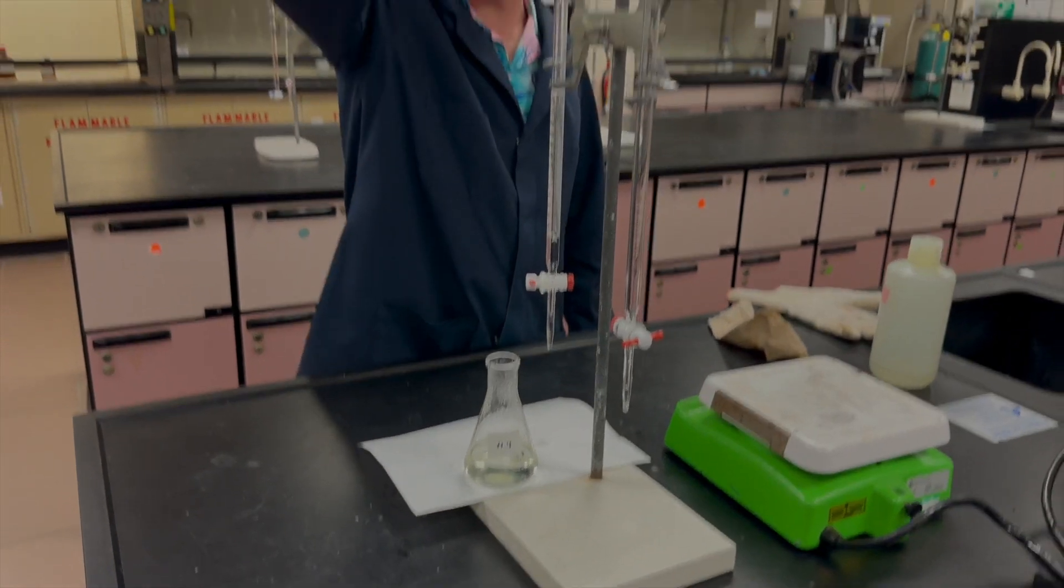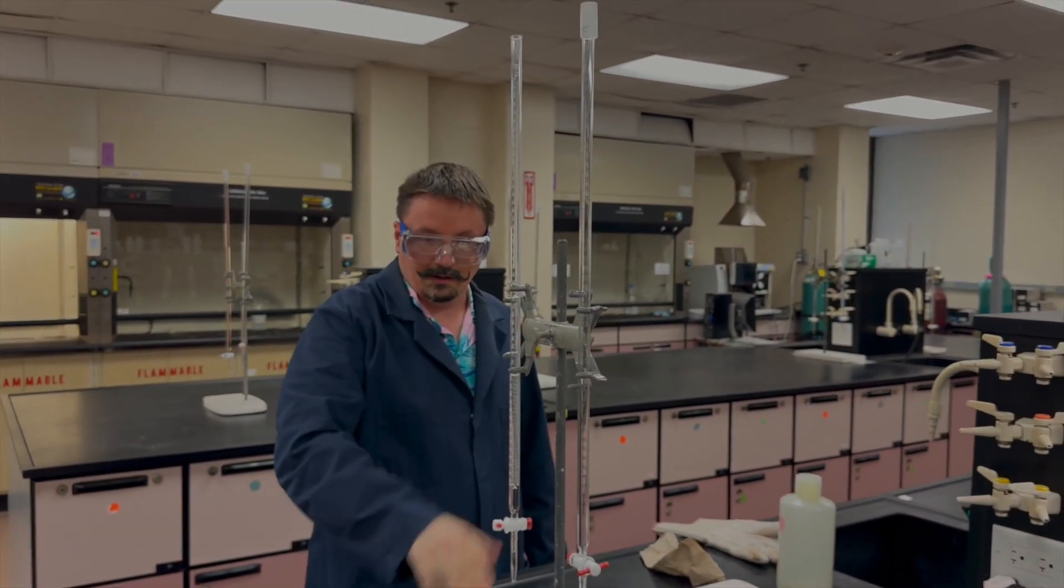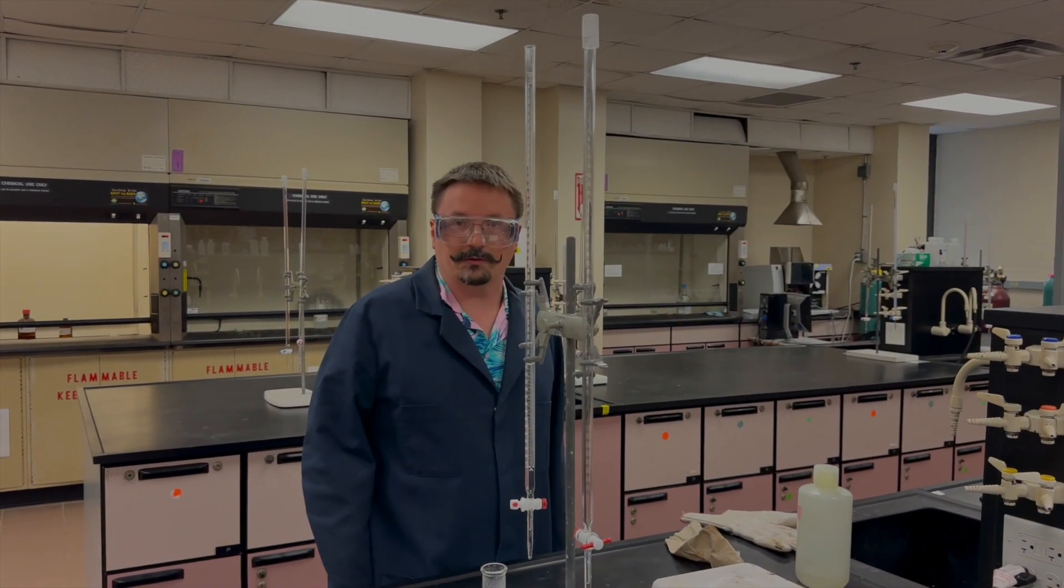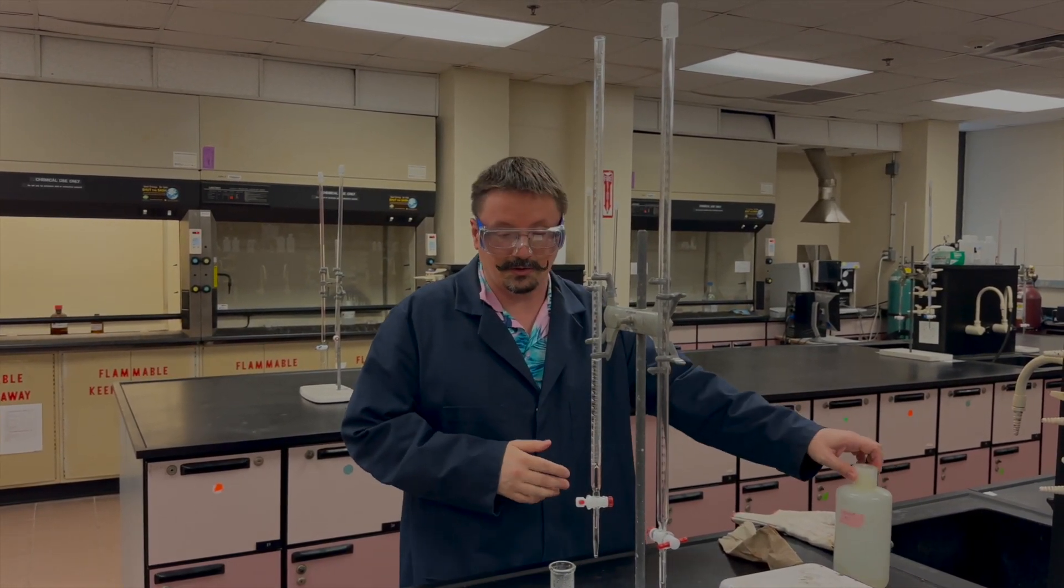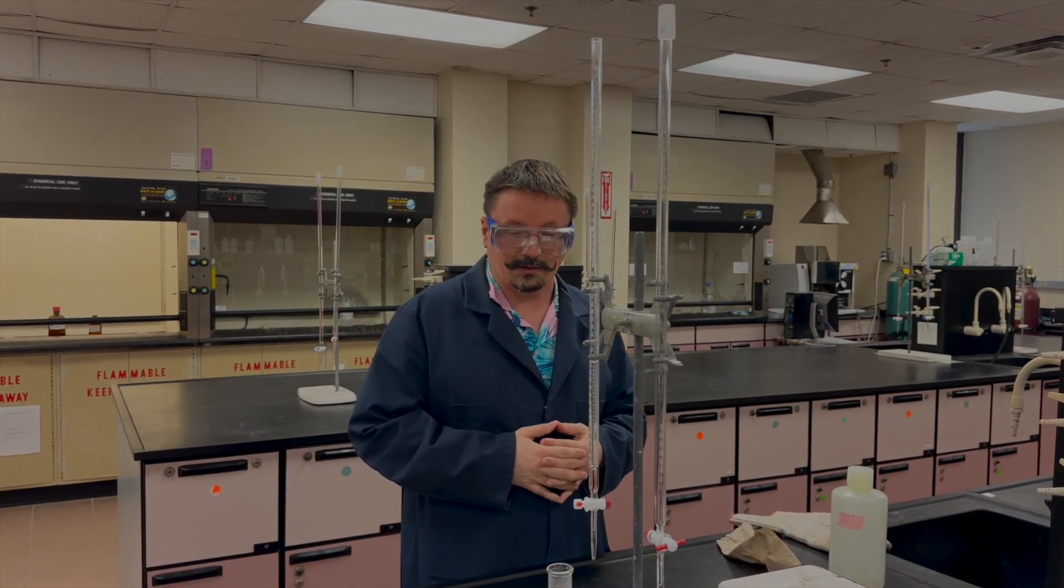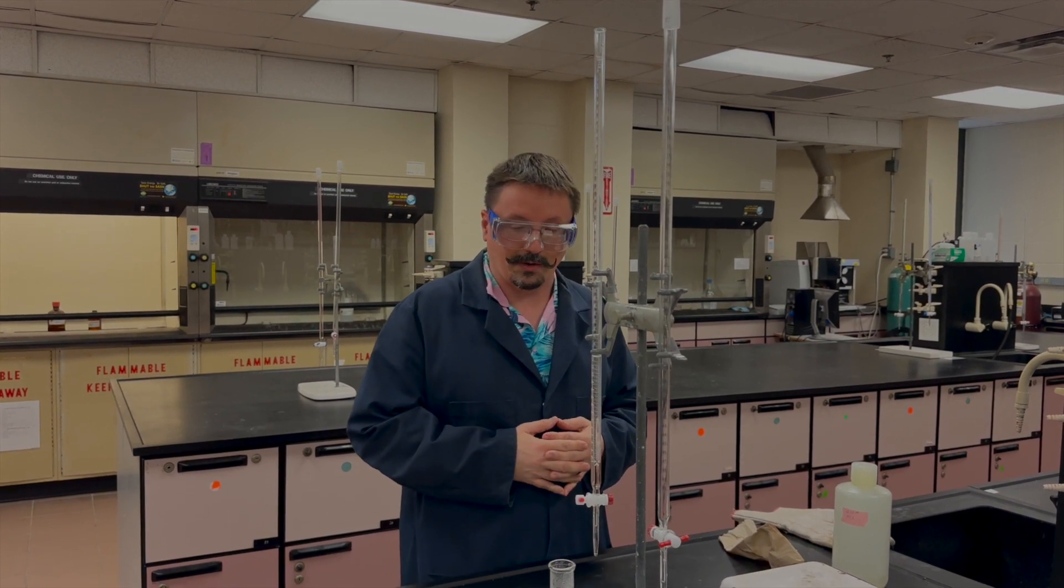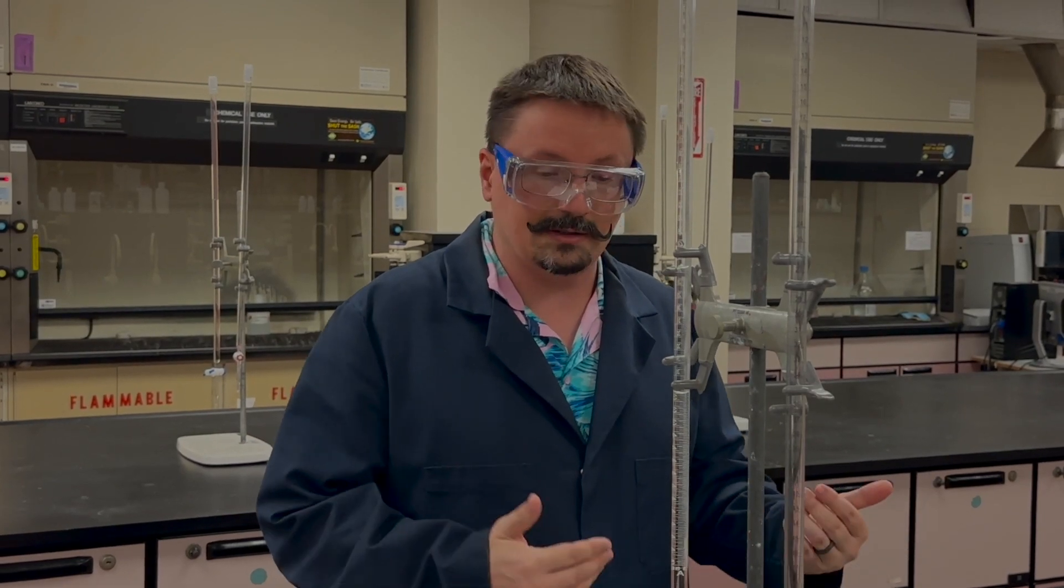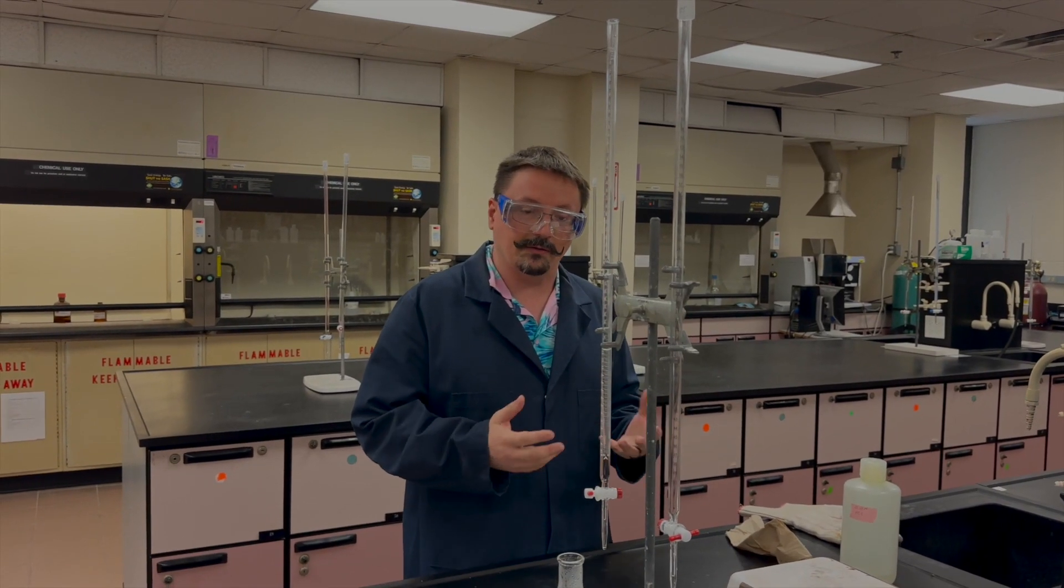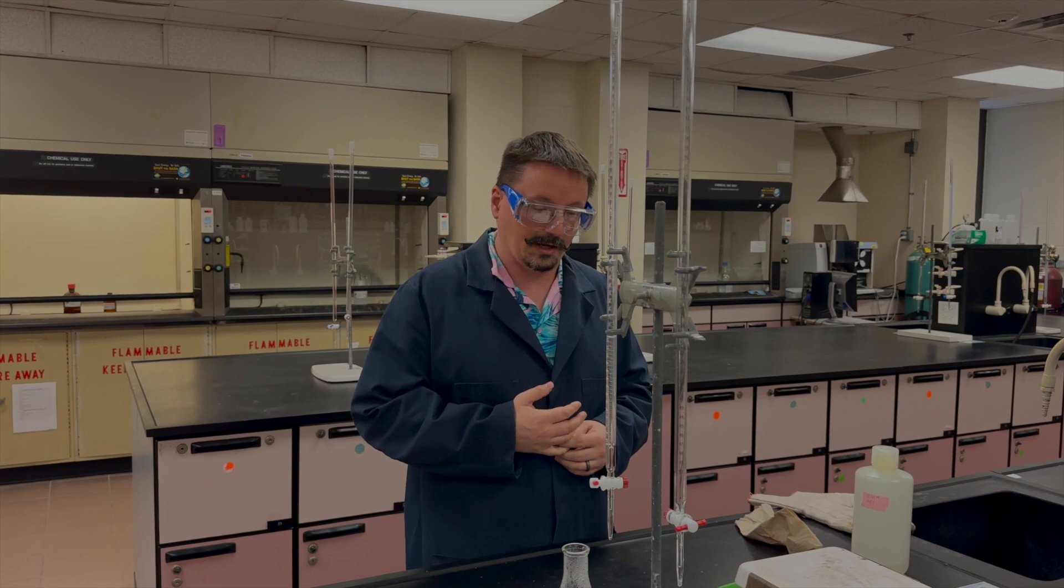Then your total volume from where you started from the very pink until yellow is what you're going to want to report or utilize to figure out how much HCl did you use to titrate that soda ash, and then how much soda ash is present in there. Do that at least three times, get three good titrations, do your calculations, get an average, report your final percent soda ash. That's this experiment.